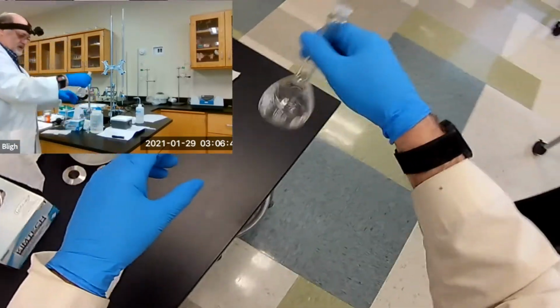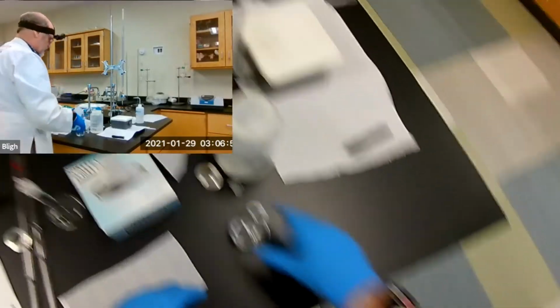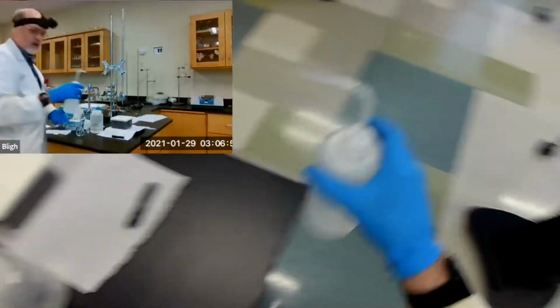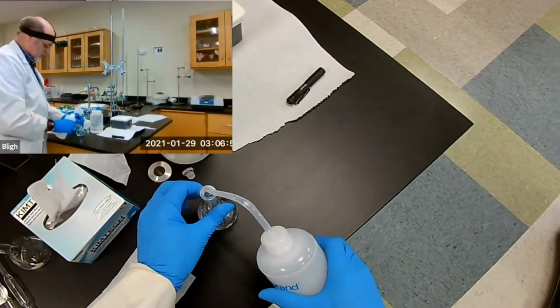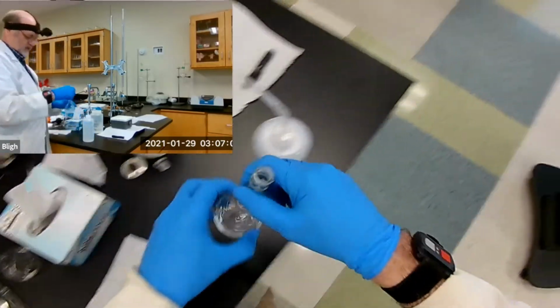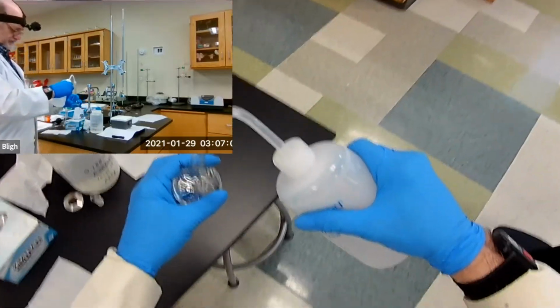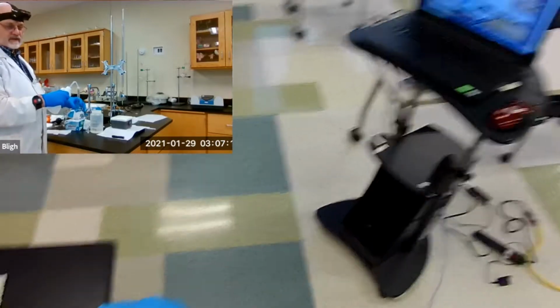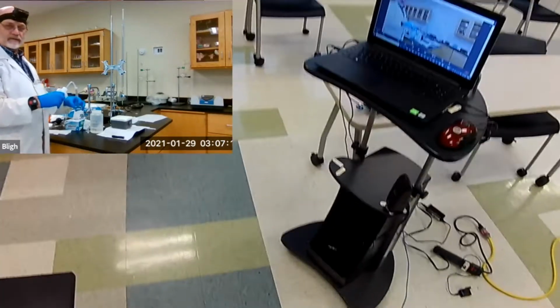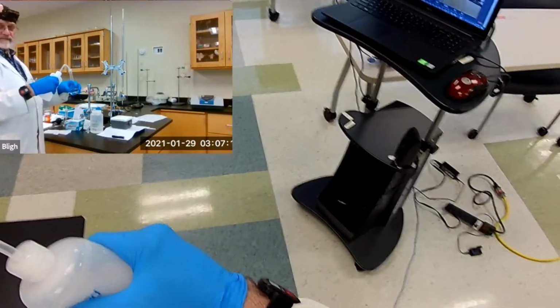All right. So there we have both solutions, but we need to dilute it to 100 milliliters. So I need a wash bottle with distilled water. Wash down the sides for sure, and be sure everything is in the bottom before we bring it to volume. And then periodically we mix it. If this were a larger flask, I'd use the supply bottle and then finish it off with the wash bottle. But since it's only 100 milliliters, I can afford to squeeze.